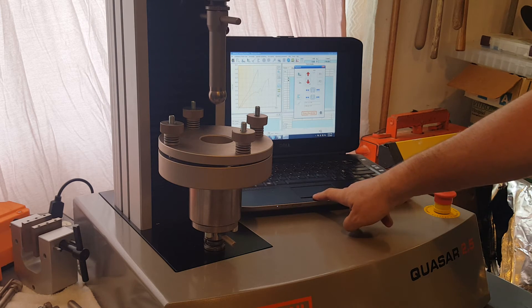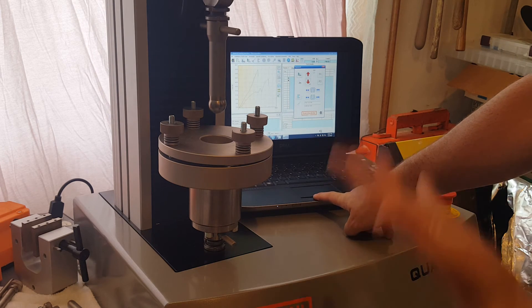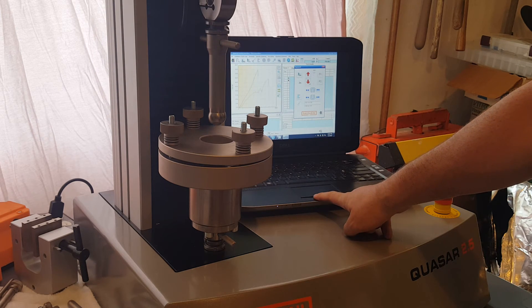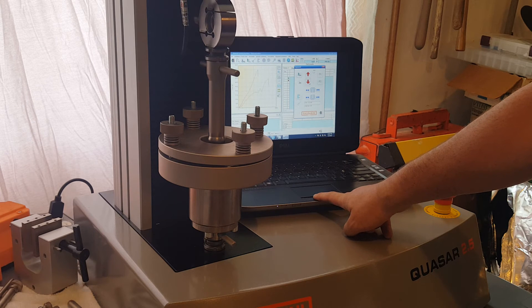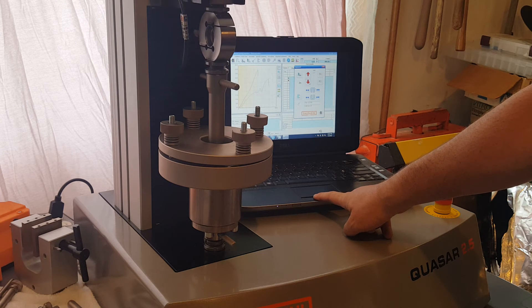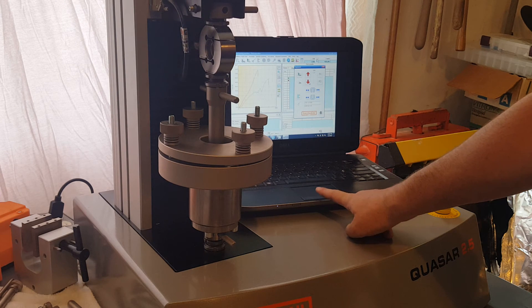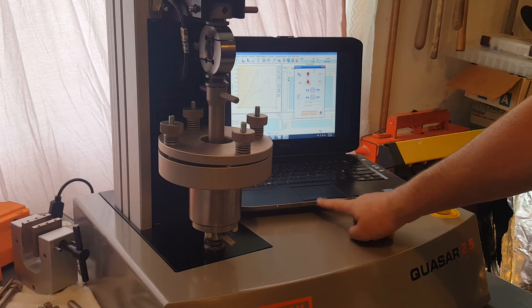So go ahead and start. See the arm coming down, coming down into the fixture. We're going to puncture it. All right.